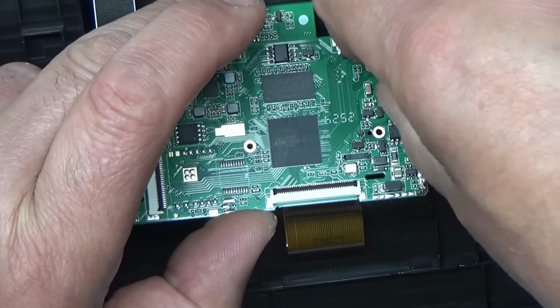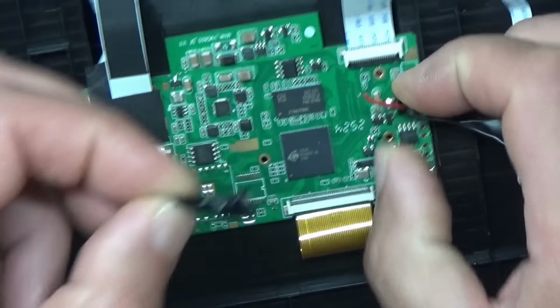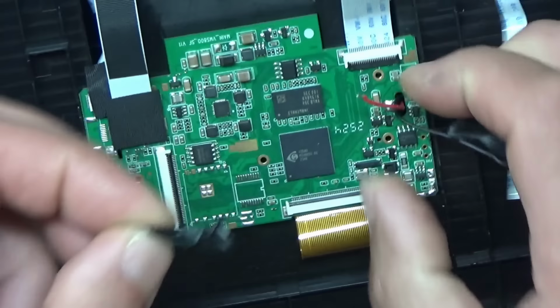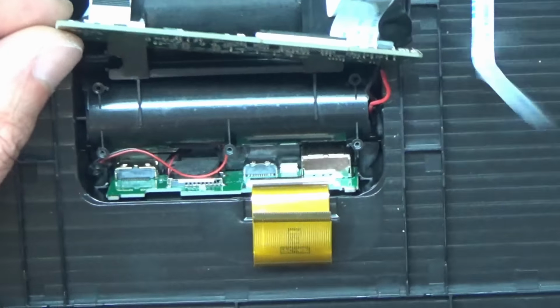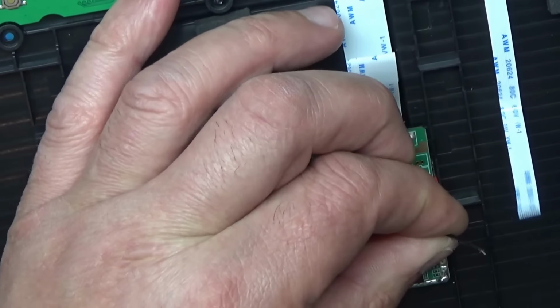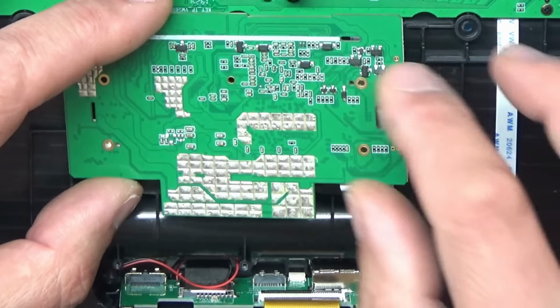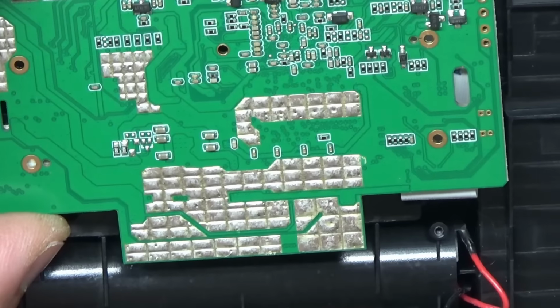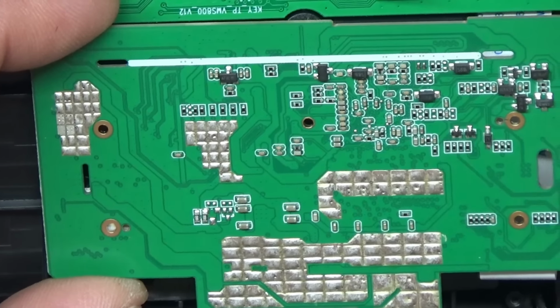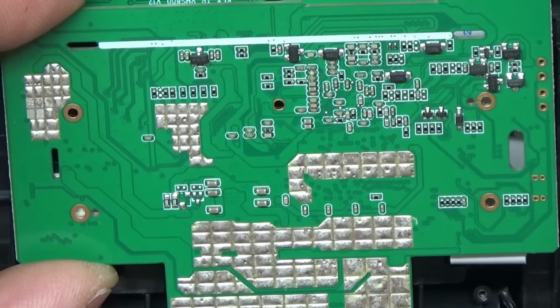I need a bit smaller tape on these wires because it's going to be a bit awkward. I'm just going to try putting a bit smaller piece of tape on these wires. Just do the same with this one, I think. Let's see what's on the back of the board then. Not a great deal, just a few discrete components really.